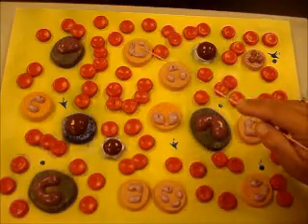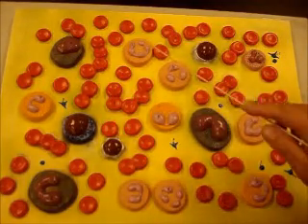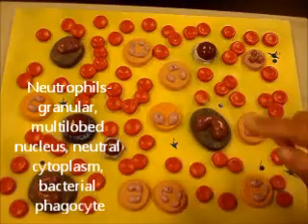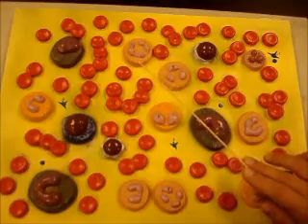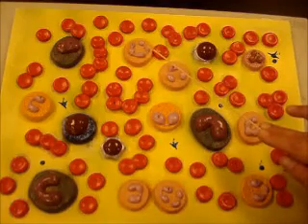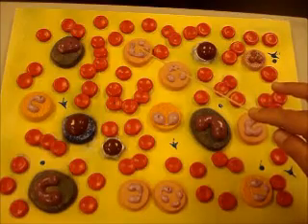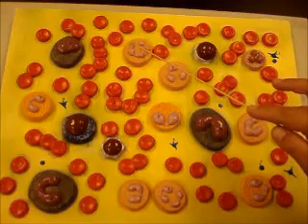We also have a lot of white blood cells or leukocytes displayed here. These peachy looking ones are neutrophils. Remember, neutrophils are going to have a multi-lobed nucleus, usually three or four lobes. Their cytoplasm will be a neutral color, usually a light purple or light pink. They're one of the granulocytes. Neutrophils are going to eat bacteria — they're phagocytic for bacteria specifically.